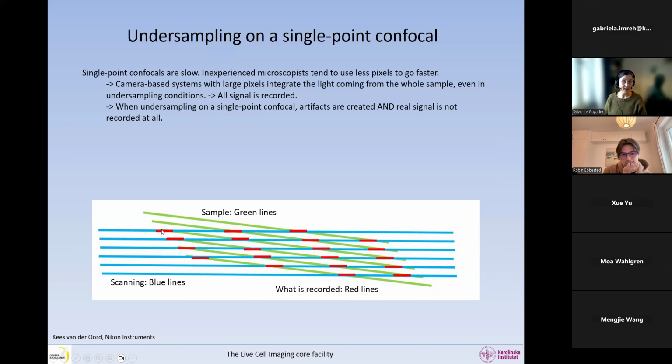And so what happens is that I measure something here, and then I measure something here because it overlaps with this green sample. And if you squint a little bit, what you're going to see is red lines, thick red lines in this direction.